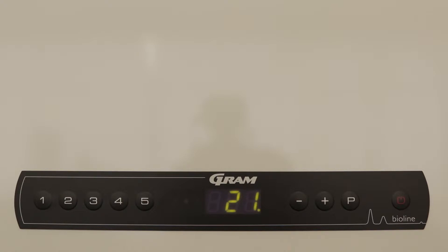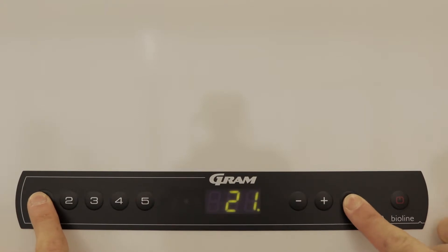P is used to select a menu step or a temperature setting, while the Power button is used to navigate back through the menu. To open the menu, you must press and hold P and 1 simultaneously for 3 seconds.